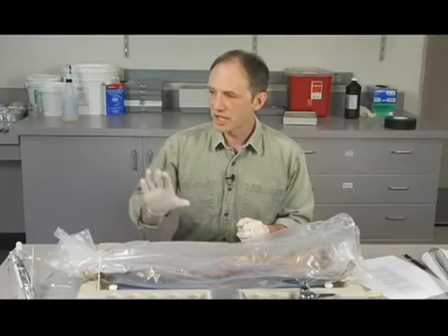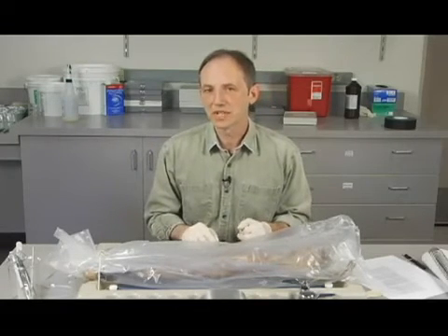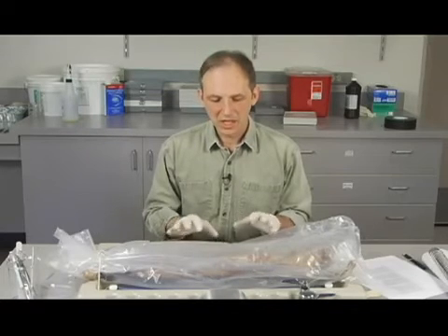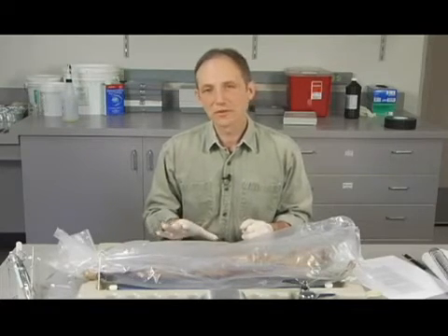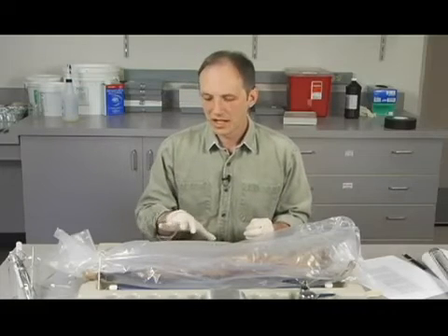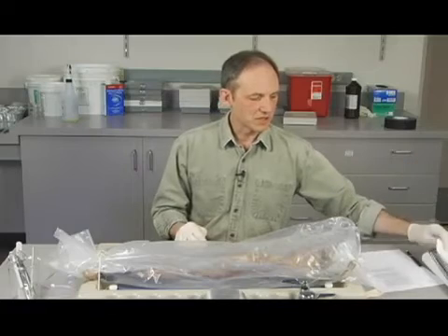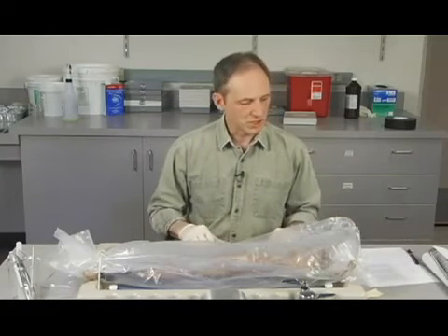We're just going to go ahead and put that away, and when you come to class, I'll tell you where. I'll show you how the specimens are put away, and it will be available for you next time. We don't have to refrigerate it or do anything like that. The preservative will take care of that. So that's essentially what we need to do to finish up.